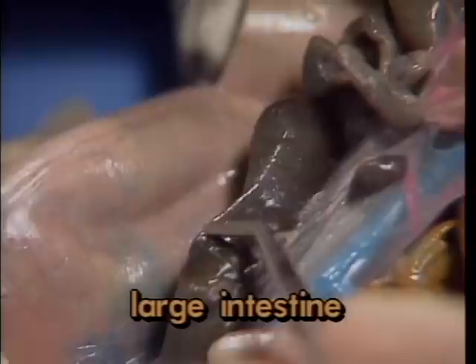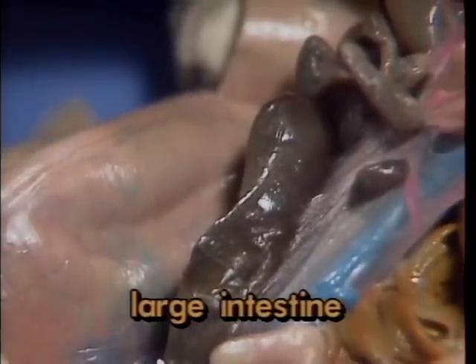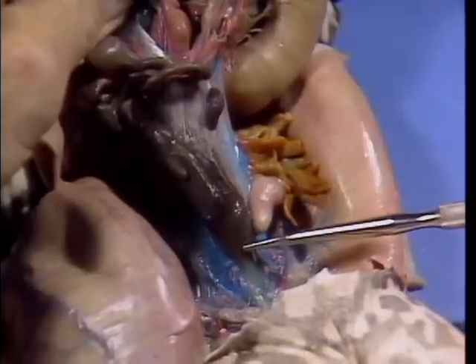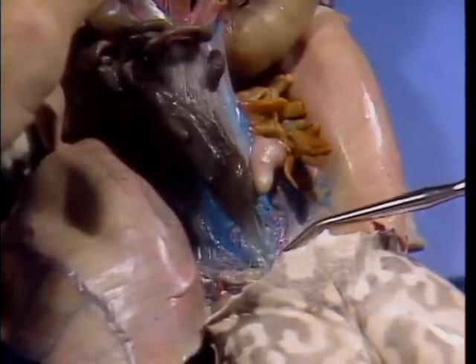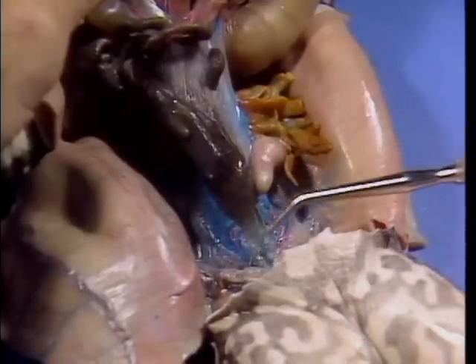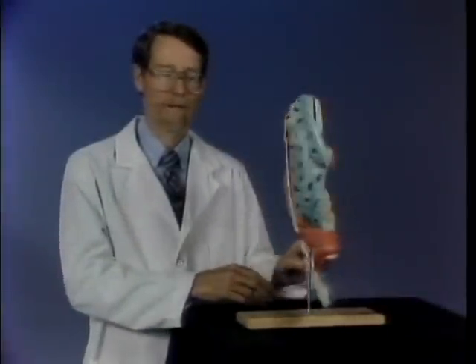By this point, most of the food material has been digested and absorbed across the intestinal lining into the bloodstream for immediate use or stored in the liver for future needs. From the large intestine, fecal material will be eliminated through the cloaca, which we noted during examination of the external anatomy. Once again, let's review what we've learned in this section.